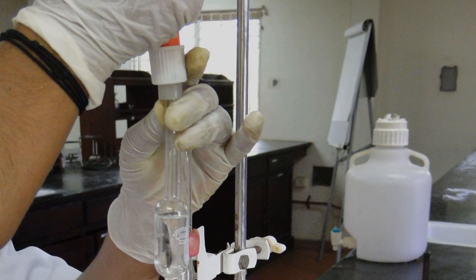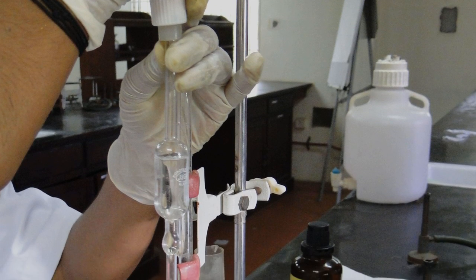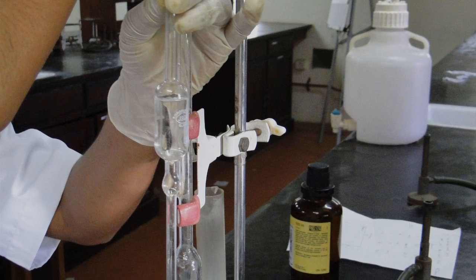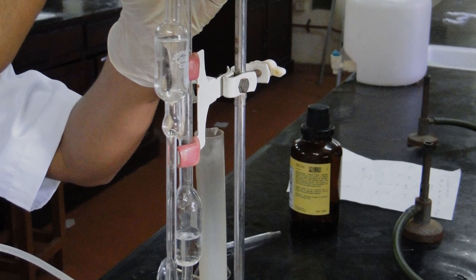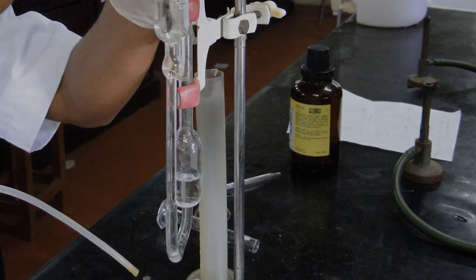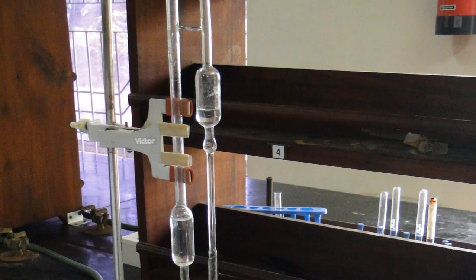A sufficient volume of distilled water is introduced by pipette in bulb B so that the bent portion of tube and half or a little more than half of bulb B are filled up. Clamp the viscometer in quite vertical position.